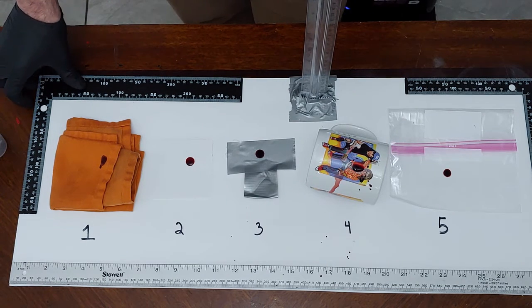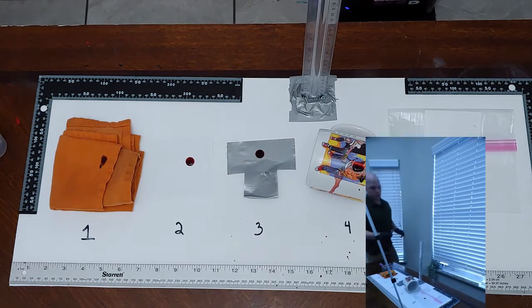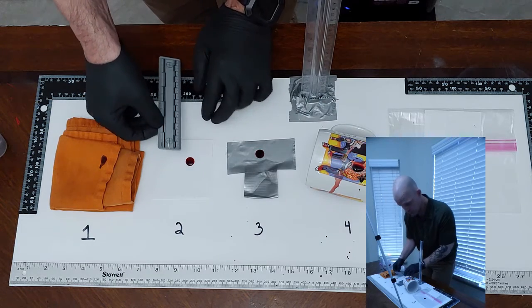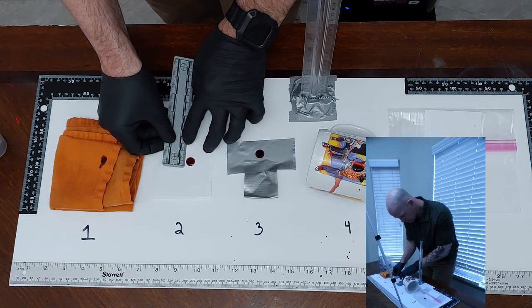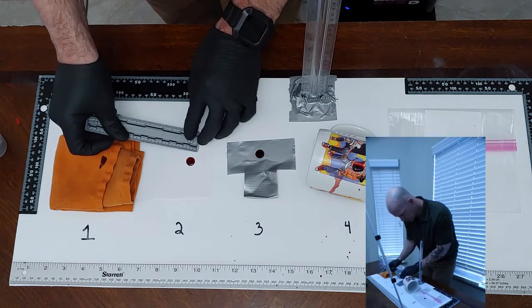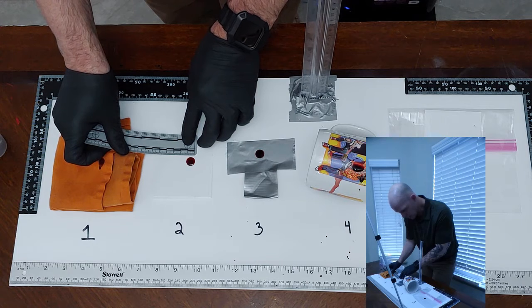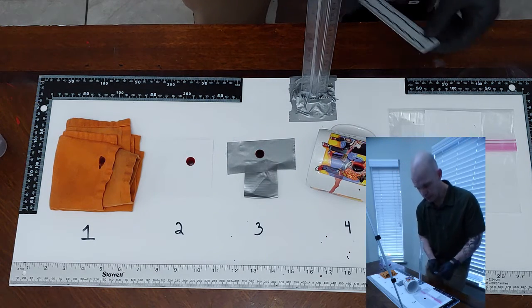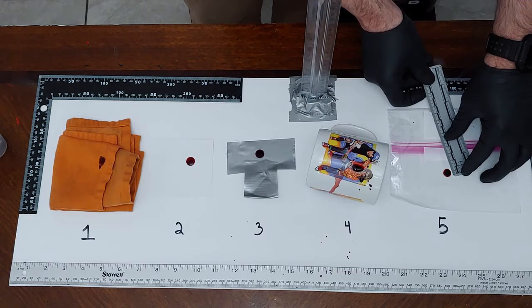I'm going to measure, let me grab a measuring device here. I'm going to measure these, just the diameter of the paper versus the plastic. Okay, so I'm going to measure these in millimeters. Okay, so we have almost exactly 1 centimeter, maybe 12 millimeters diameter blood stain on the paper. On this, it's exactly 1 centimeter.